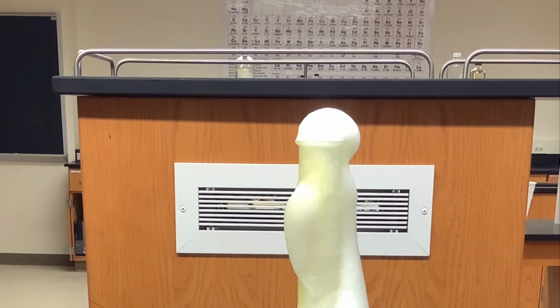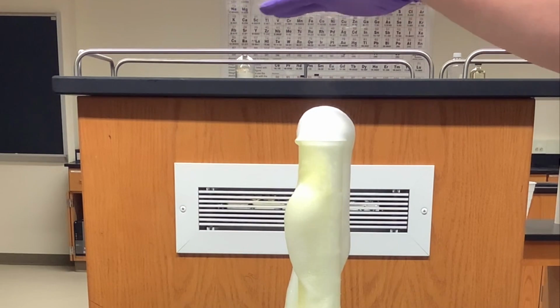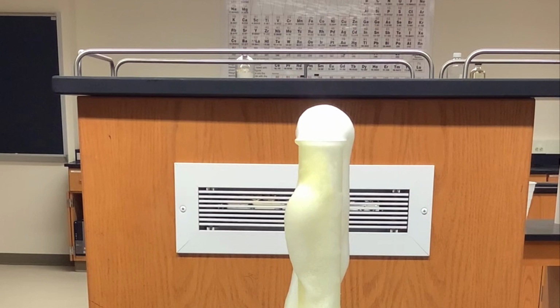And at some point my splint gets wet from the bubbles, and that's why it doesn't relight. So you may not be able to see it in the video, but there's a lot of steam coming off of the top of this reaction. It's because it is an exothermic reaction. So it is giving off heat. It's giving off so much heat that it's actually boiling the water product that we've generated.